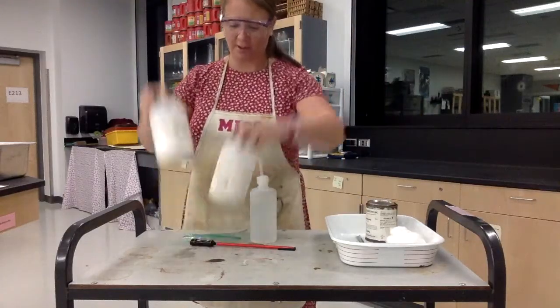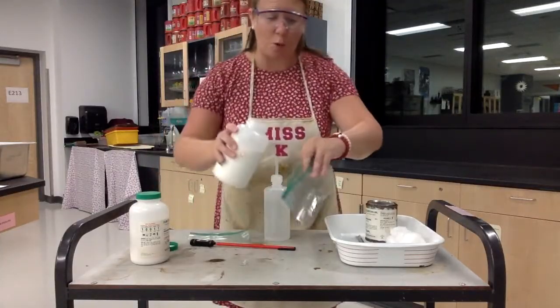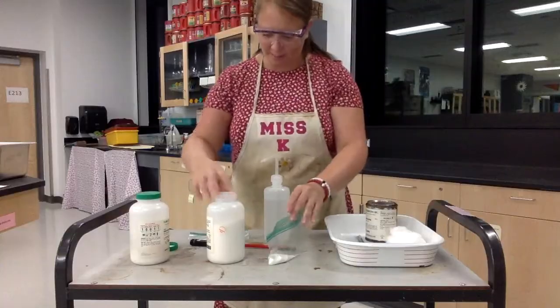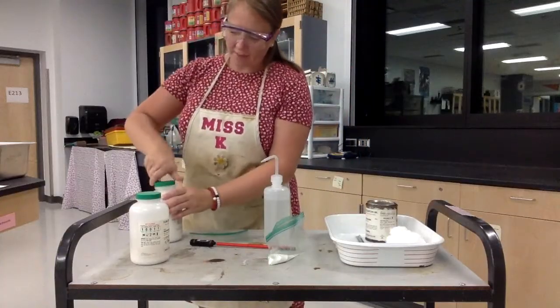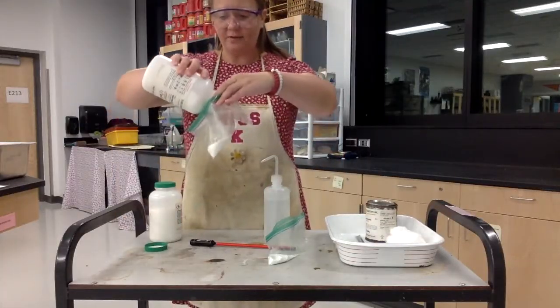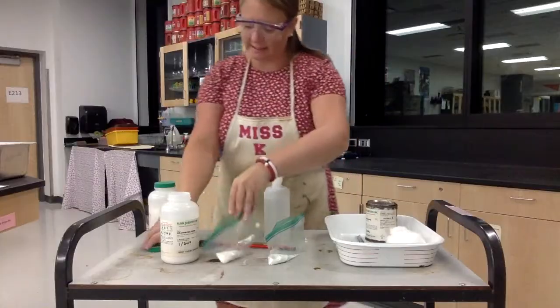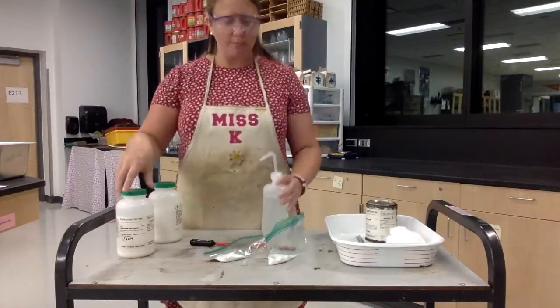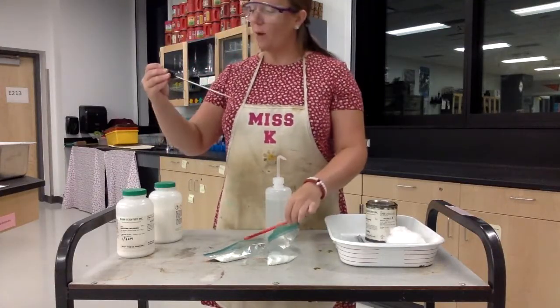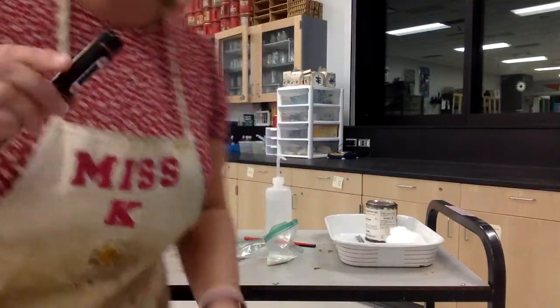So the first thing I'm going to show you — I have two chemicals here. This one is called ammonium nitrate. It looks kind of like white beads, like those little white beads when styrofoam falls apart. I'm going to put it in a baggie. The other one I have is calcium chloride, which looks like white chalky, kind of hard pieces. I'm going to add some water to them. Right now I'm using a digital thermometer — it's about 23.1 degrees, about room temperature.